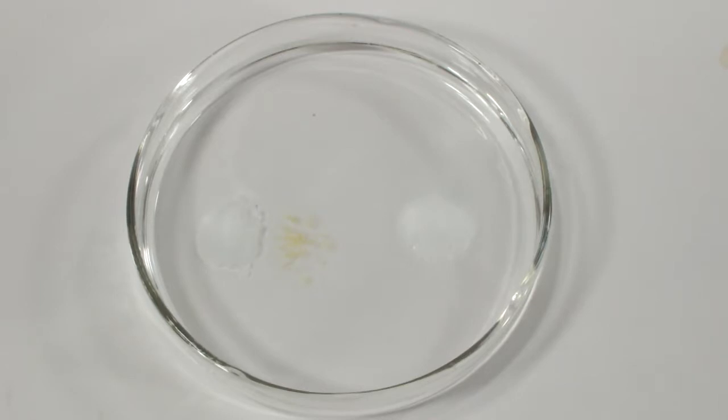Very quickly, a little bit of the yellow color shows up near the lead nitrate and begins to spread rapidly. You can also see that the potassium iodide dissolves completely much faster. The iodide ions seem to be moving toward the lead ions quicker than the other way around. The crystals are forming a little bit slower, so they have a chance to grow and shine a little more than when you just dump the two solutions together. You end up with a pretty effect.